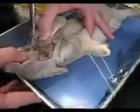See the epiglottis? The what? That's the flap of skin that keeps food from going down your lungs and directs it into your stomach.